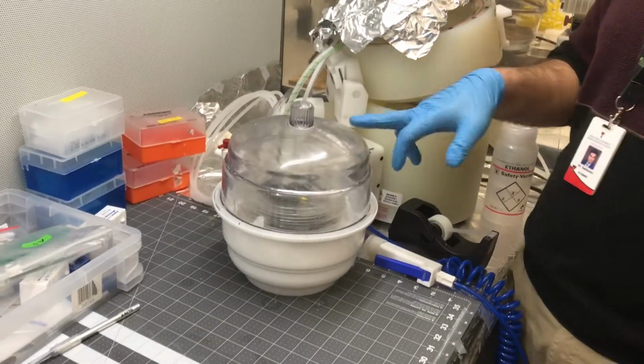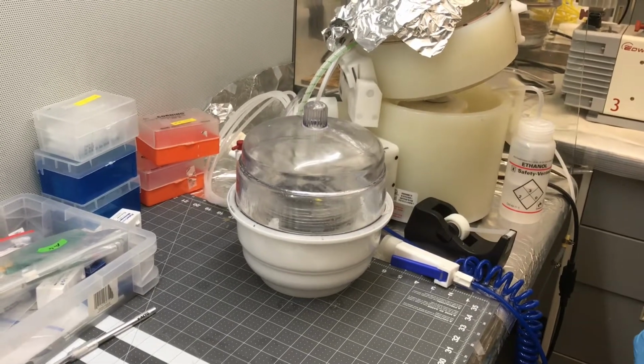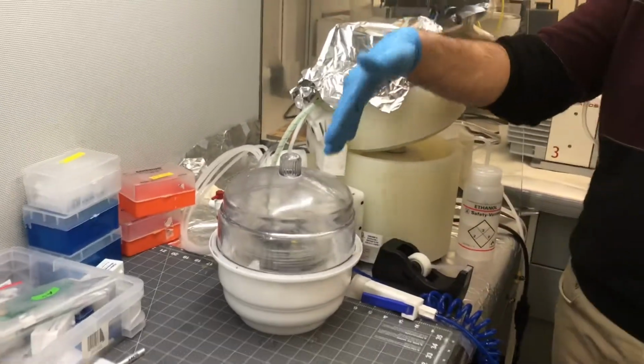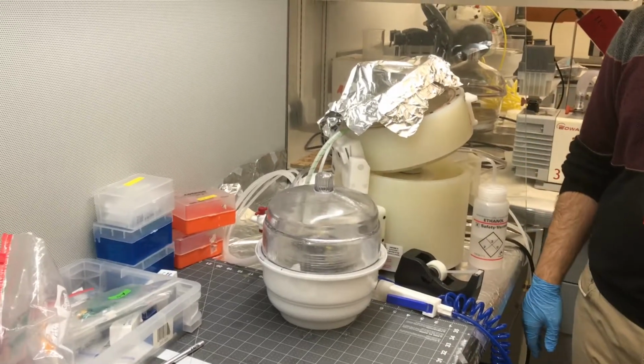So that's the reason it's not good. So Ali, after you put those chips inside after PDMS, how long usually? You said 15 minutes? 10 to 15 minutes. 10 to 15 minutes, but this one is based on the area that we have now. But also you have to keep watching whether this bubble is gone.